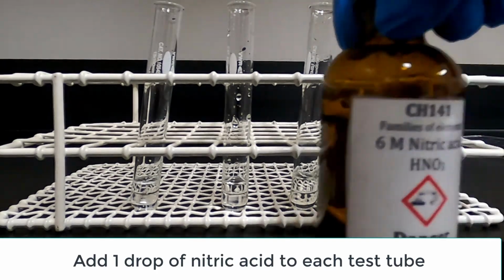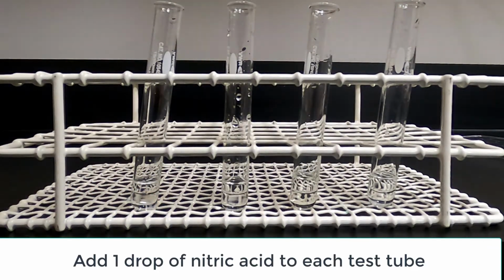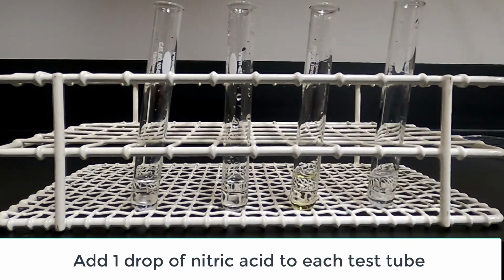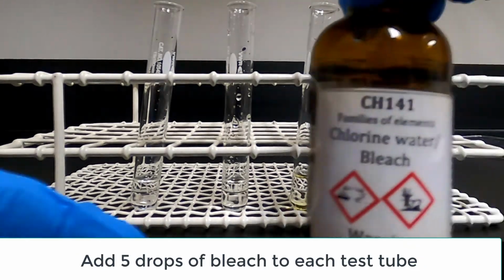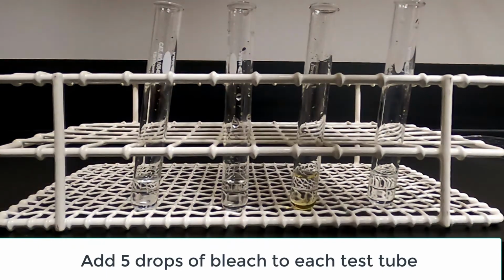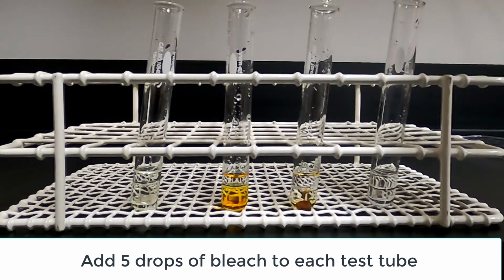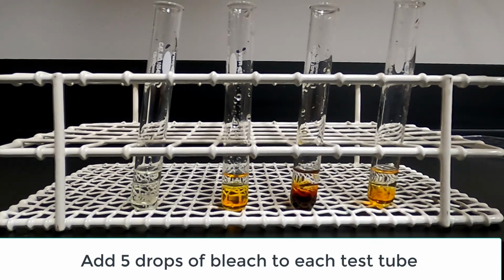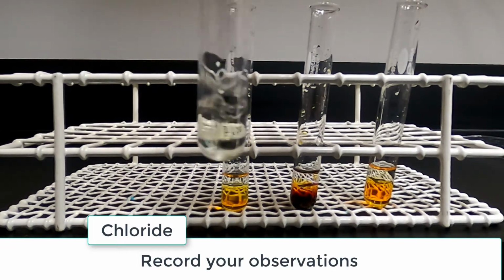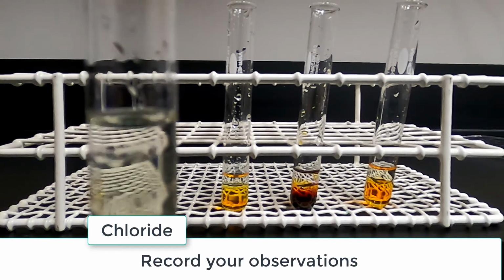one drop of nitric acid, and 5 drops of bleach. Gently mix the solutions. Observe the color of each test tube. Record your observations on the data sheet.